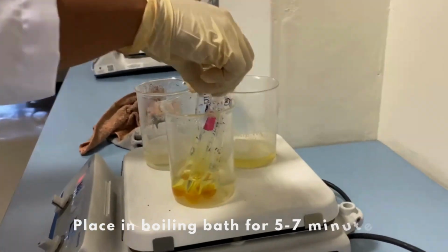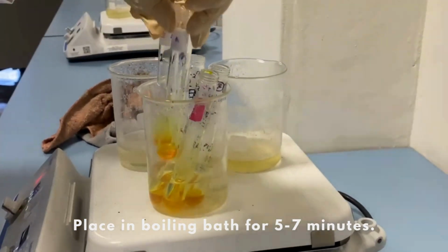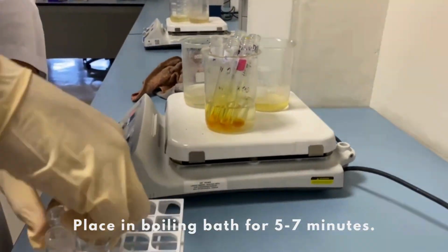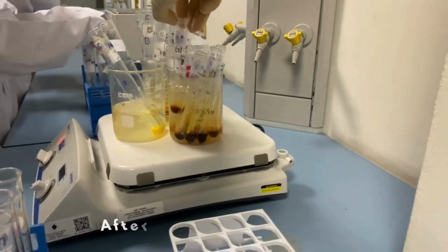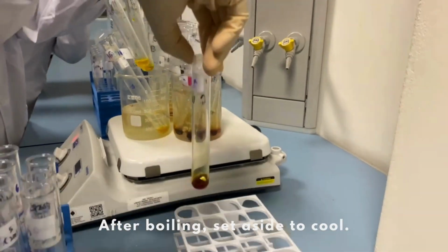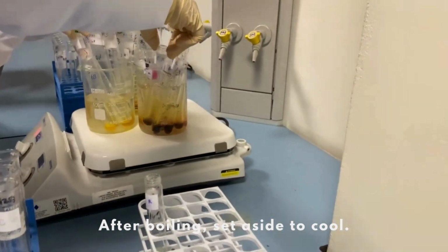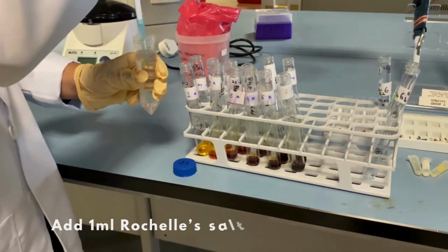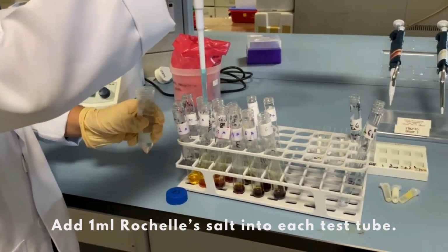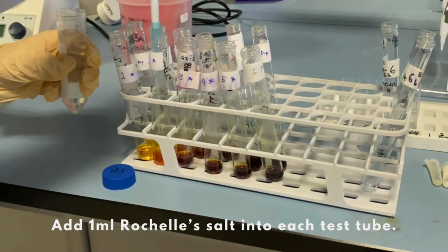Proceed by placing the test tubes in a boiling bath for 5 to 7 minutes. After boiling, set aside to cool to room temperature. Continue by adding 1 ml of Rochelle salt into each test tube.